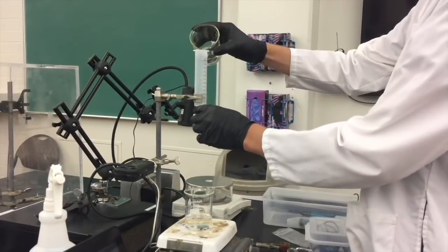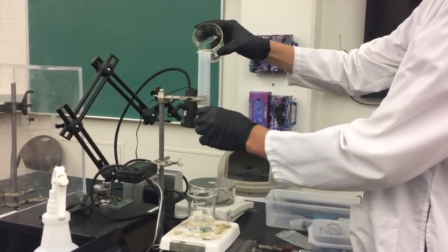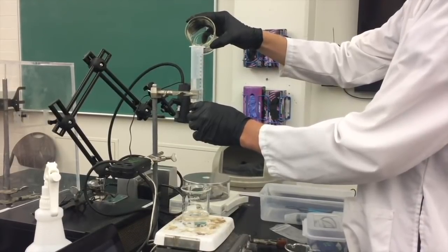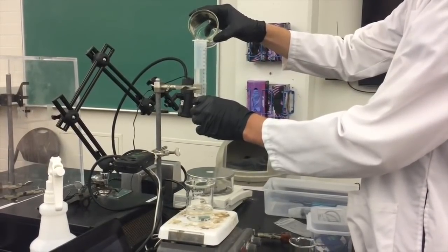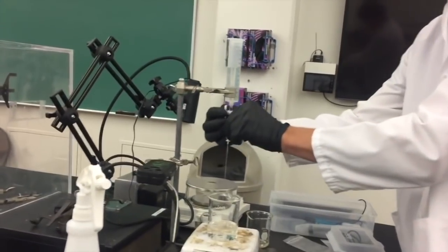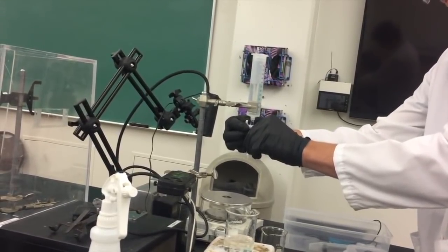You're now ready to add the NaOH that will be used in your titration runs. Make sure that both stop cocks are closed then add about 40 milliliters of NaOH to the syringe. Open the bottom stop cock completely and then use the top stop cock to adjust the flow to about one drop per second.